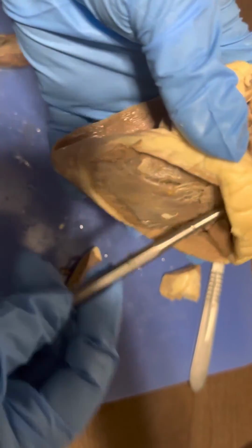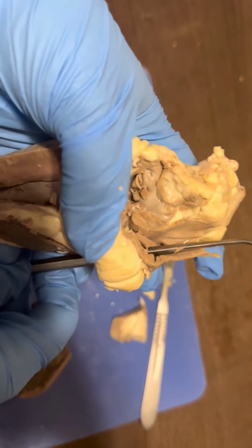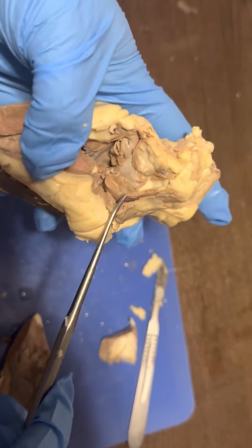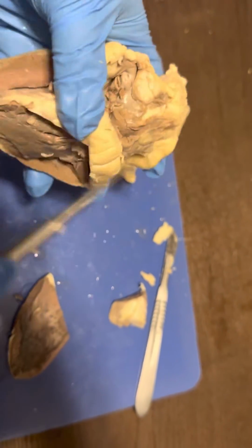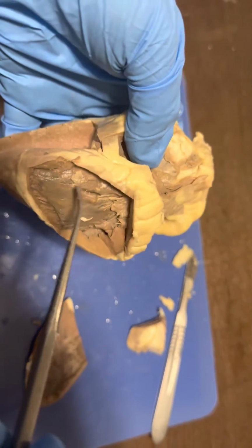From the left ventricle, we go up through the semilunar valve into what would be the aorta, with the oxygen-rich blood. The aorta has a far wider stance than the pulmonary trunk, as it has more blood that it has to push through.